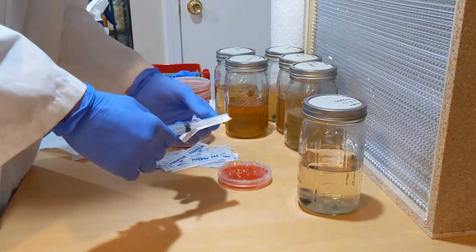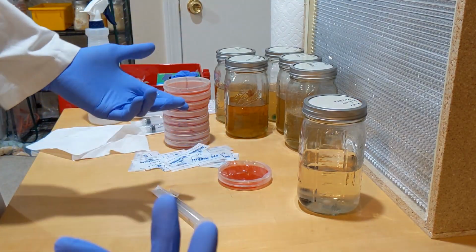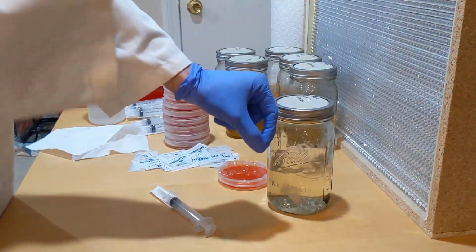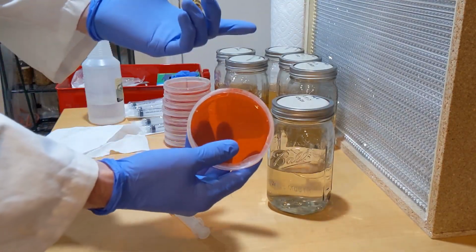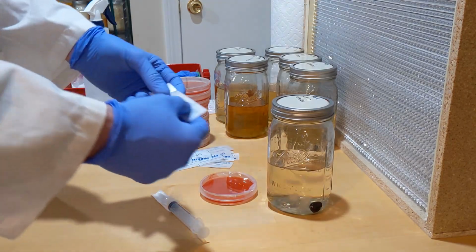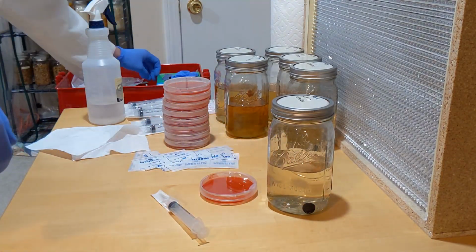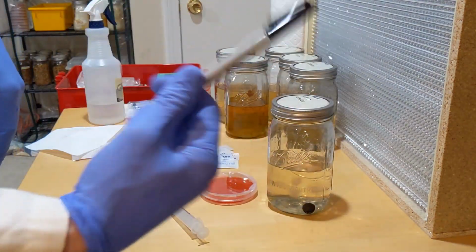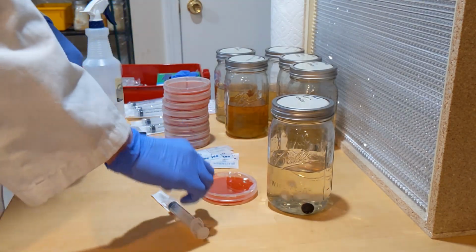So I'm gonna stop talking, and I'm just going to swirl this, take a little bit of that culture in the syringe, and then we're gonna drop it on the agar. And then we will wrap it with parafilm. And of course, one of the most important things is labeling. So make sure we do that. Let's do it.